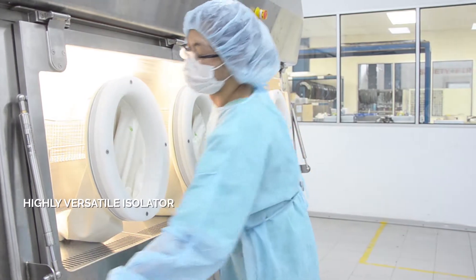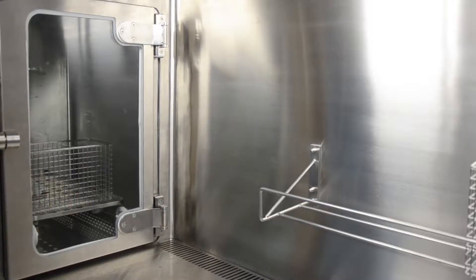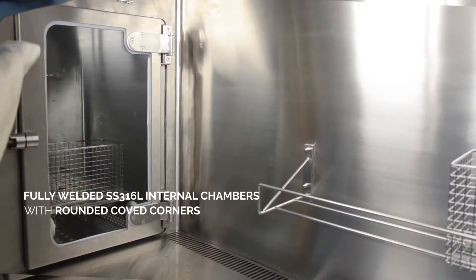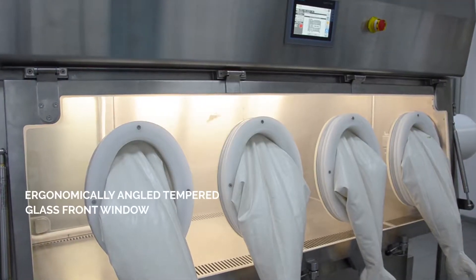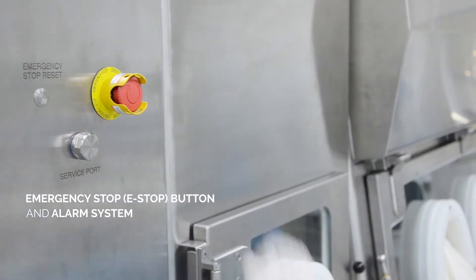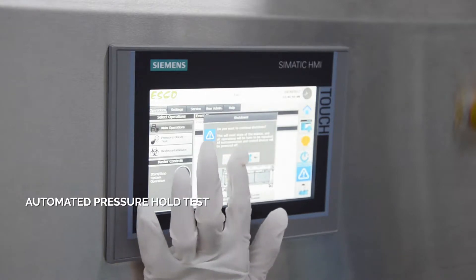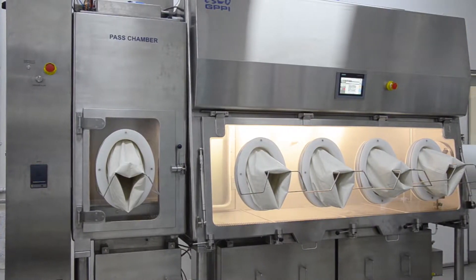These features make the GPPI a highly versatile isolator that can be used for potent or non-potent aseptic materials and processes. The GPPI is built from fully welded SS316L internal chambers with rounded coved corners. It has an ergonomically angled tempered glass front window and is equipped with an emergency stop button and alarm system. It comes with automated pressure hold test with option for manual pressure testing.